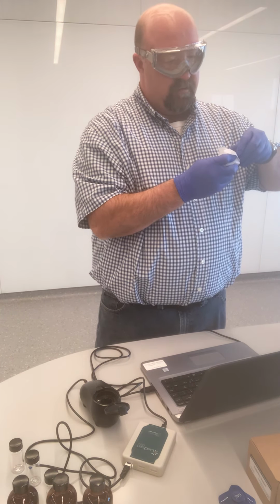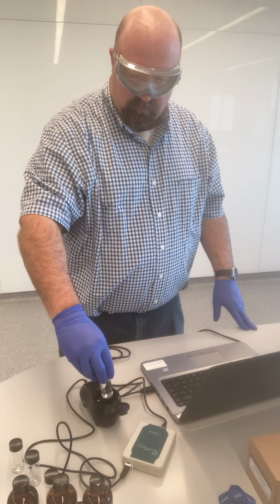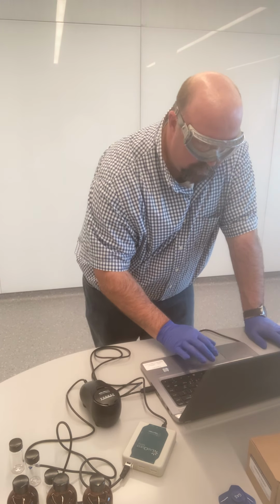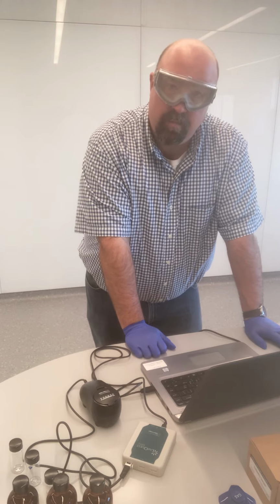Wipe this down. And now my instrument is calibrated.